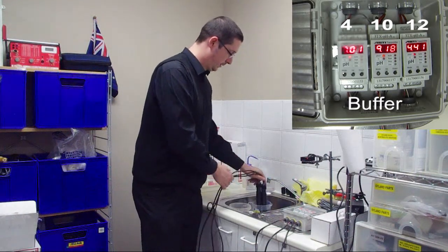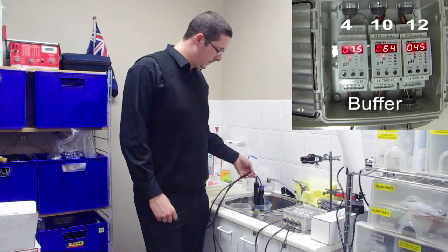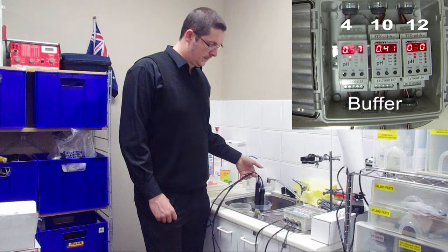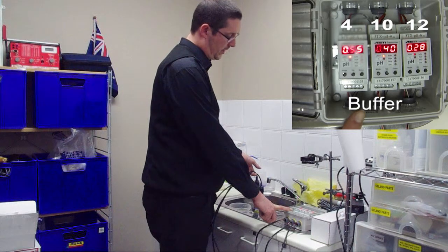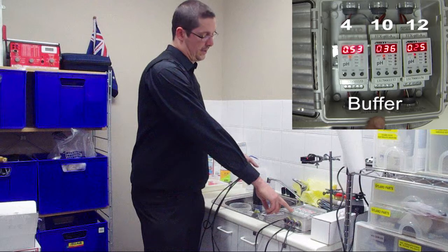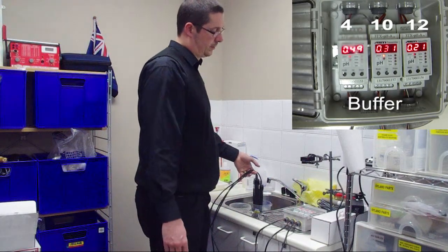The acidic solution, and still going. So the sensor calibrated to pH 4 is reporting about 0.52, 0.5, 0.49 we've come down to there. The sensor calibrated to pH 10 is giving a 0.37, 0.32 thereabouts, 0.3. And the sensor calibrated to pH 12 is reporting around about a 0.2.